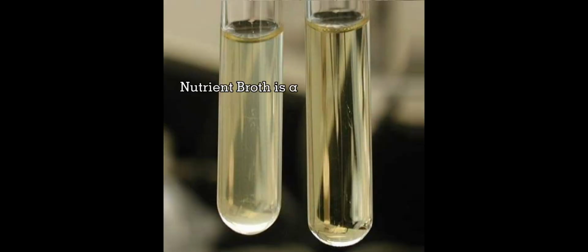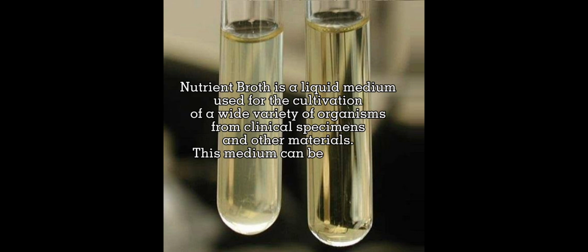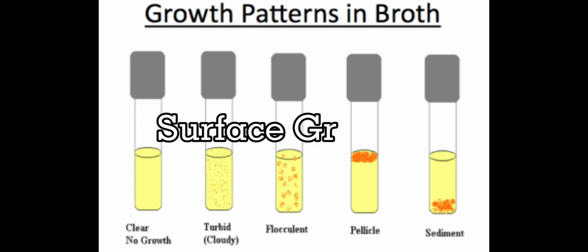Characterization of bacterial culture in nutrient broth. Nutrient broth is a liquid medium used for the cultivation of a wide variety of organisms from clinical specimens and other materials. This medium can be enriched with other ingredients such as blood. Surface growth: ring at upper margin adherent to glass.